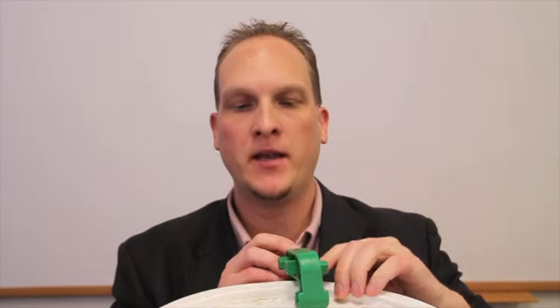This is how we open the lid. You take this little c-shaped thing, you go around the circumference of the lid, prying up in various places, and then voila — the lid opens and you have access to your hearts.